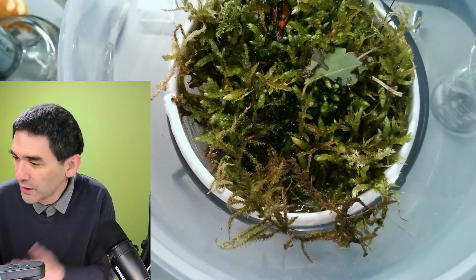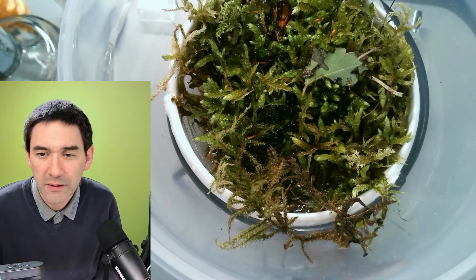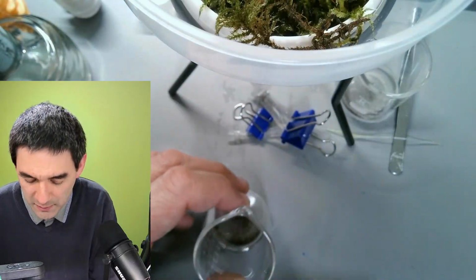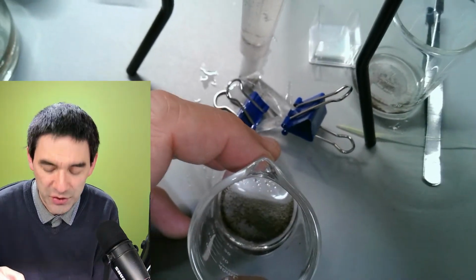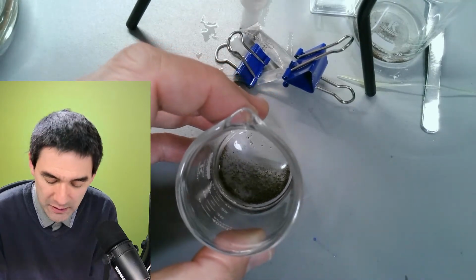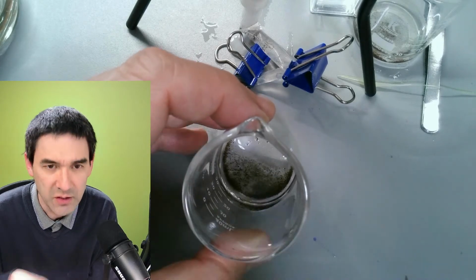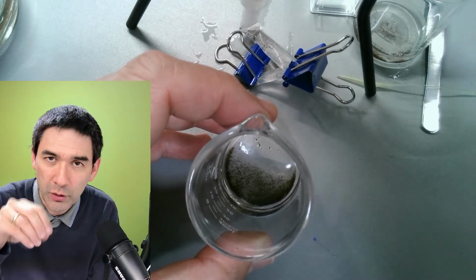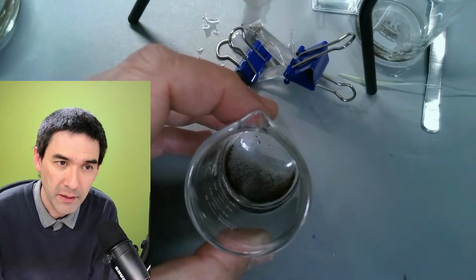And you know what we're going to do is I'm just going to try to find a few more, and then maybe we're able to find some more things in here. I have to say that of course it's possible to also directly rinse out the moss on a petri dish like I've done before many times. But actually, I do get probably better results with this. And one of the reasons is that if you rinse out the moss in a petri dish, you have all of those sand particles as well and all these things, and they're all being held back now by the mesh.